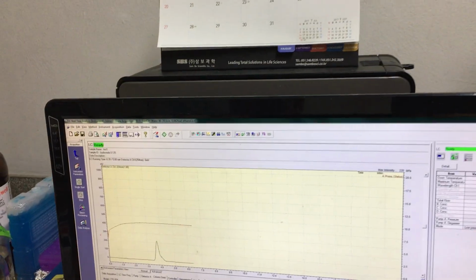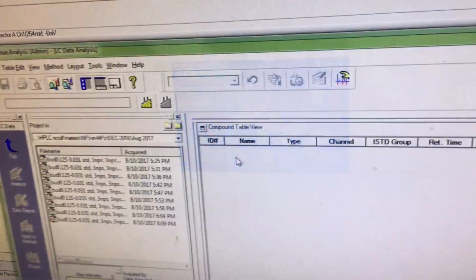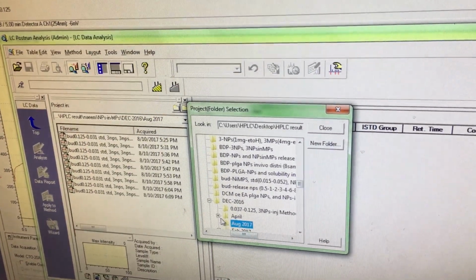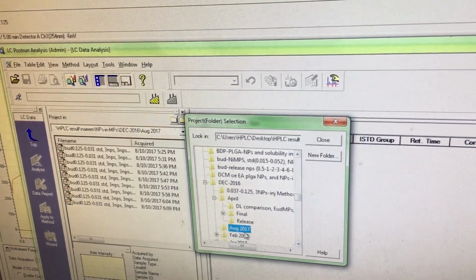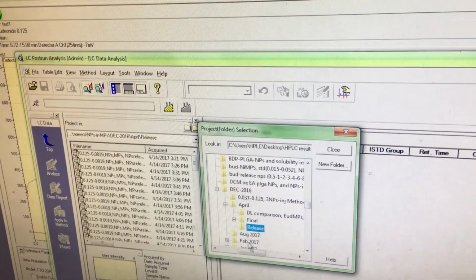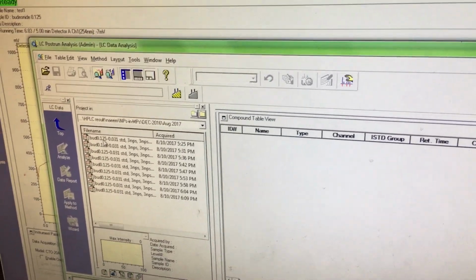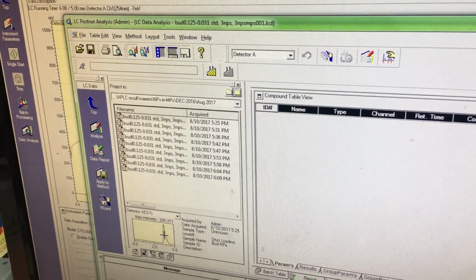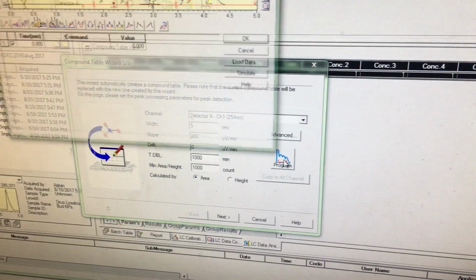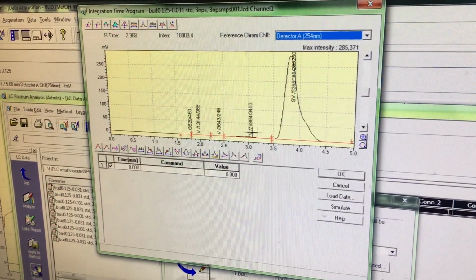So now I want to see the result. Post run, but the result will take time. Then this folder, because I know my folder, there are many folders. Suppose this was another standard, for example the same sample from another group. I click it, this is the wizard, and this is a different peak. So this was our peak. You can see it starts from 3.5.